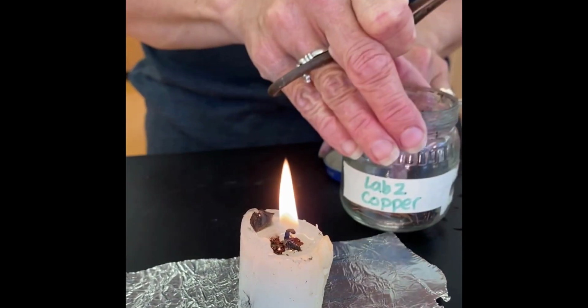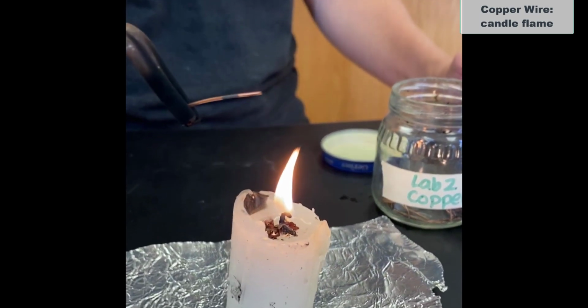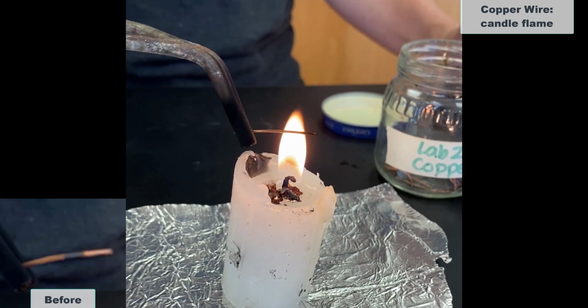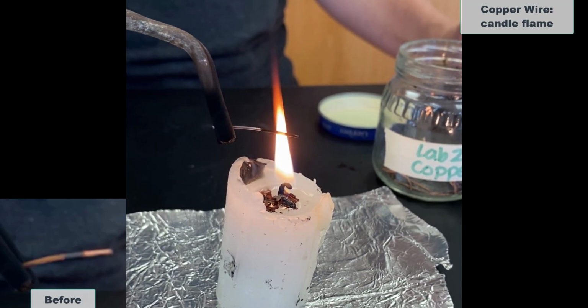And now we're going to try copper. This time it's in the form of a wire. So there's what it looks like beforehand. And in the flame. Not much happening there.